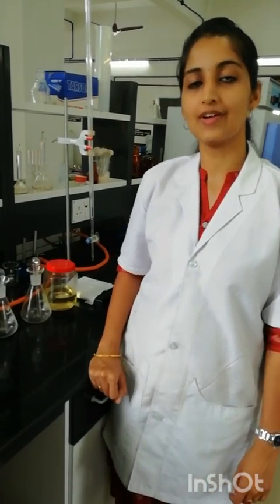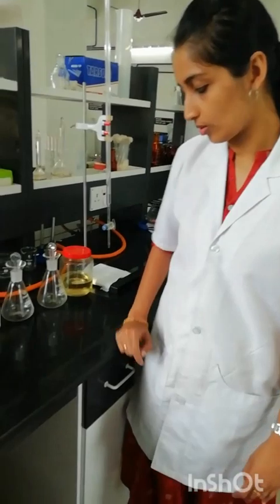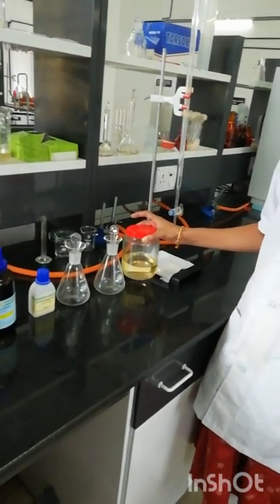Welcome students. Today we are going to do the experiment estimation of saponification value of oils. To do this experiment we are taking the oil sample, coconut oil.